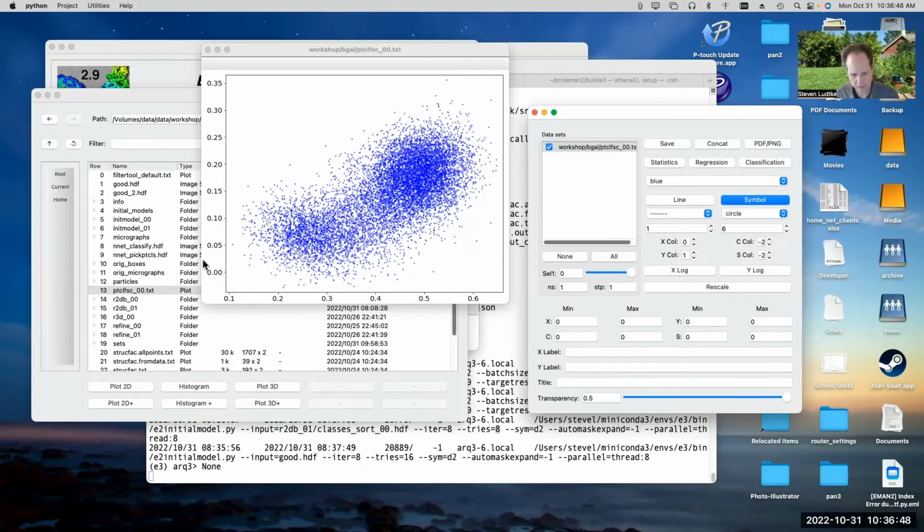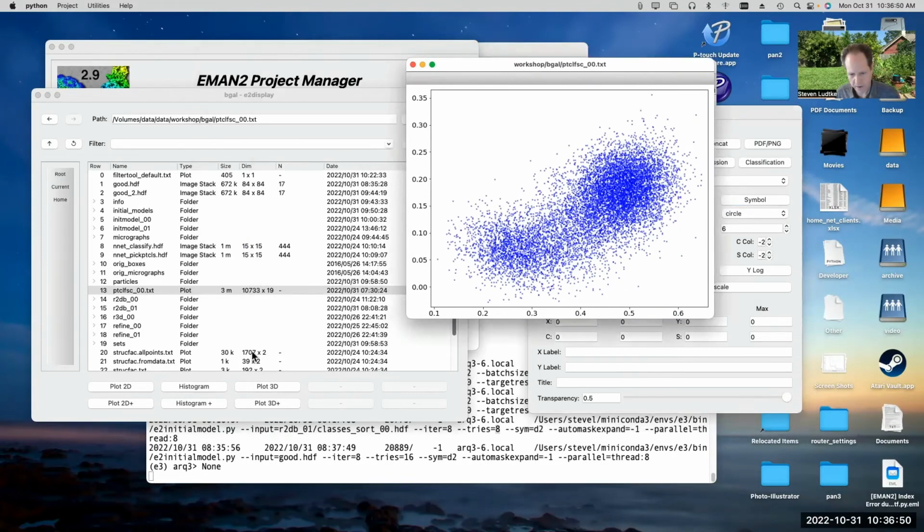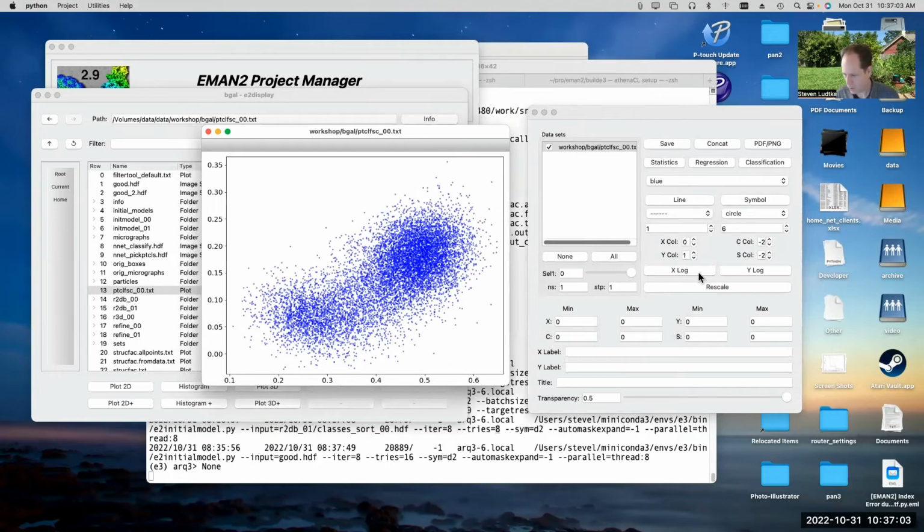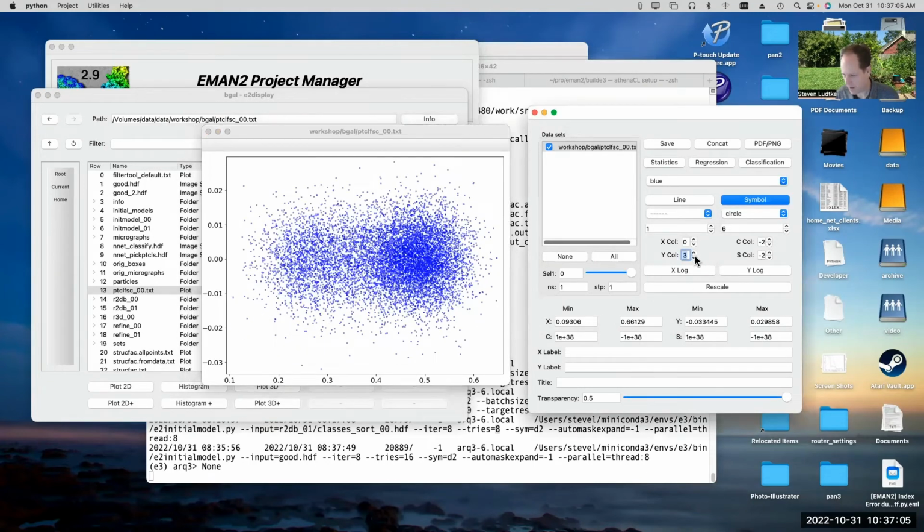So this data file has 19 different parameters. It's got one row per particle. There were 10,733 particles in the data set, and then it has 19 different values that it computed for each particle. So we can look at any of those 19 different values.